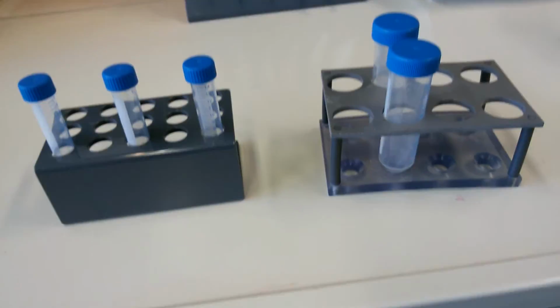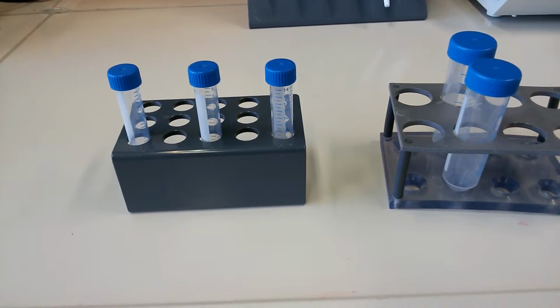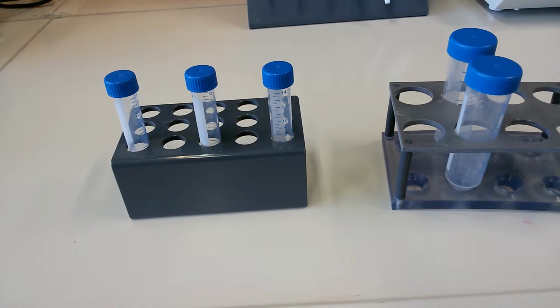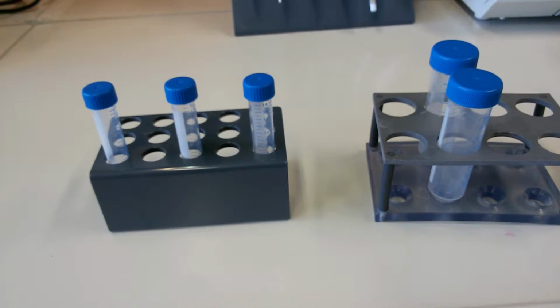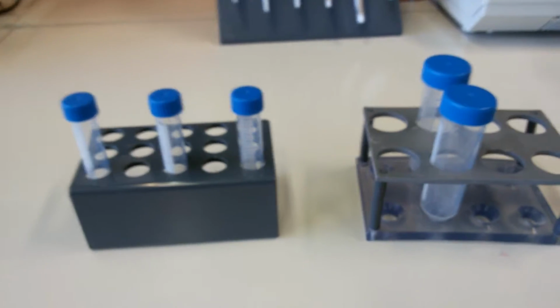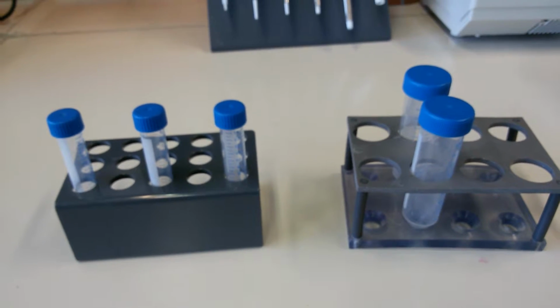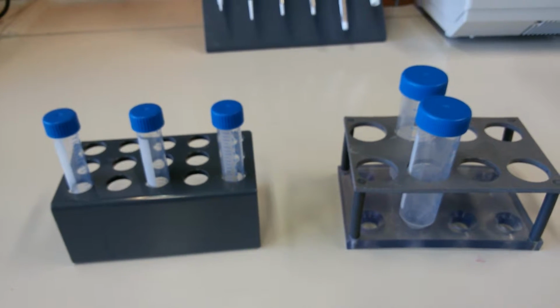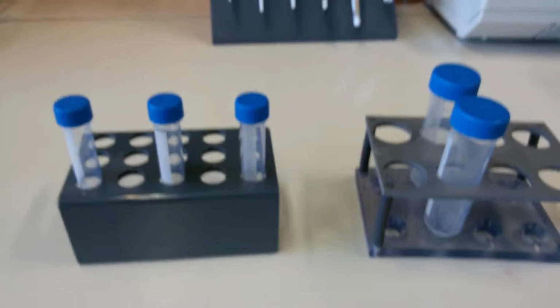It's just a short reminder: the rest of the things that I showed you before, you cannot use and throw. You use them, you wash them, you make them sterile using an autoclave, then you reuse them. With these tubes, it generally depends on the lab. Some labs prefer to reuse them, since they are autoclavable, but in my lab and for most people, they don't prefer to reuse them, so they use and throw. Great.